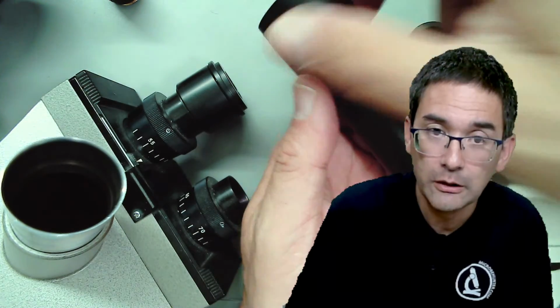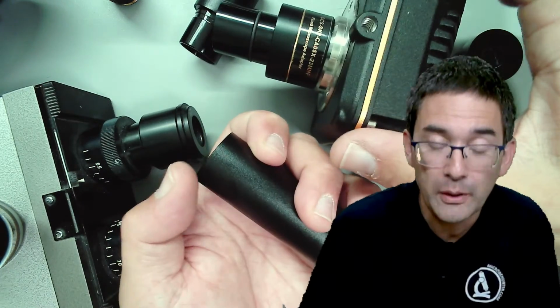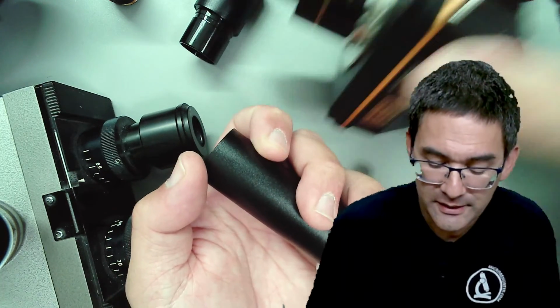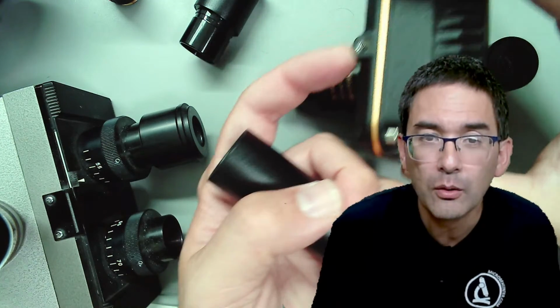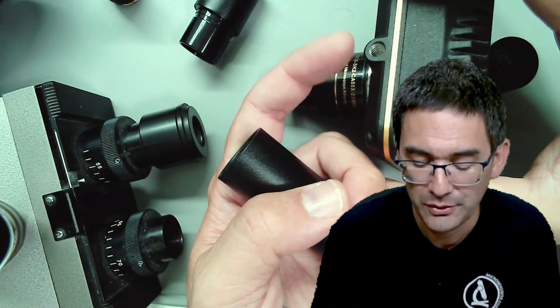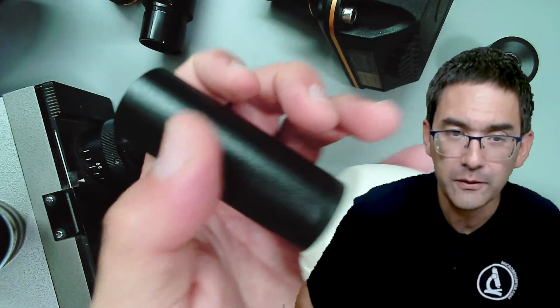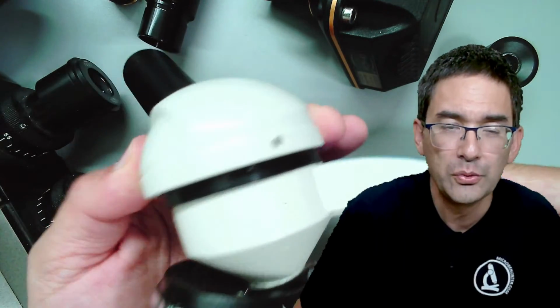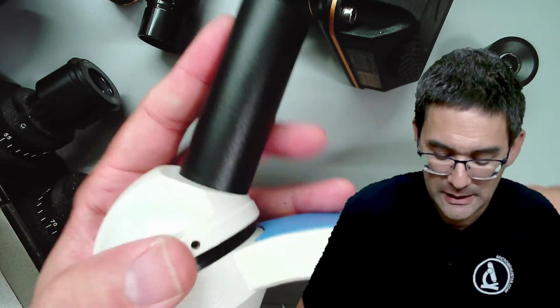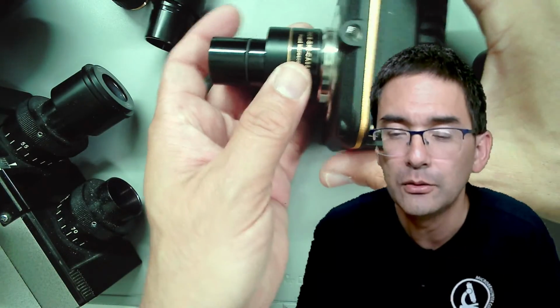Now of course a very large camera, like the one that I have over here, might be too heavy, but it still should work. And this is the reason why those heavy cameras, you see over here, you can also attach a tripod for additional support. Actually, it's not that heavy. It should work out. Or otherwise, if there's the risk of the microscope tipping over, all you do is you rotate this around here, and then the center of gravity is more in the center. But these eyepiece cameras, you should be able to connect directly and put directly into a microscope.